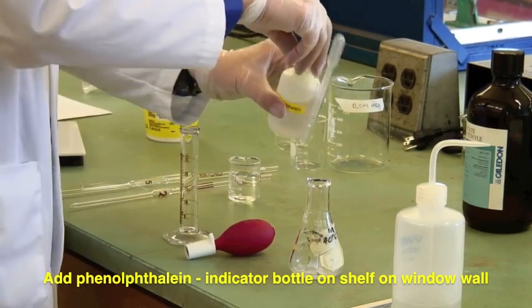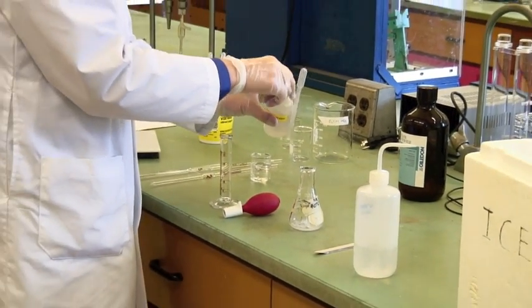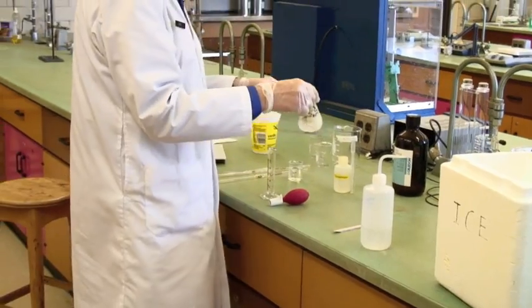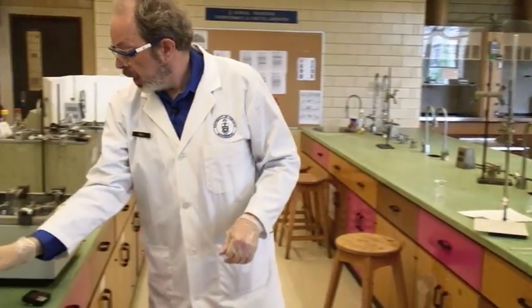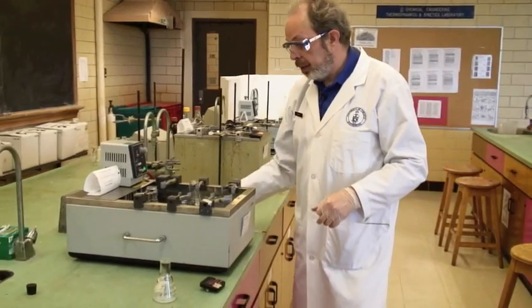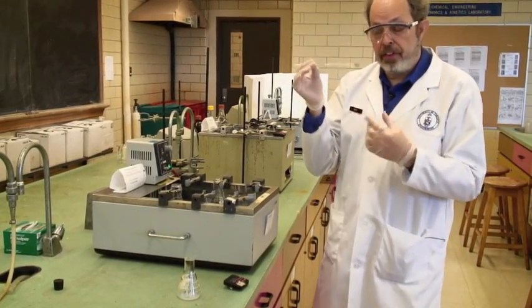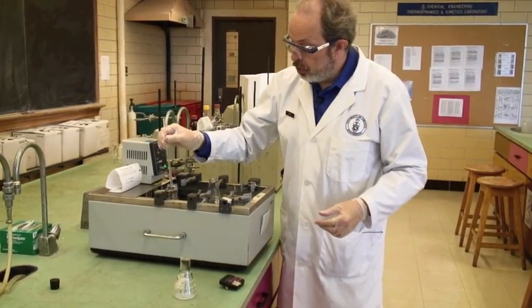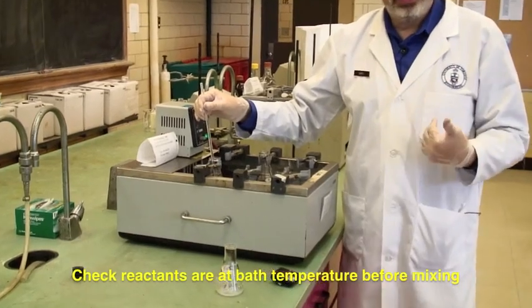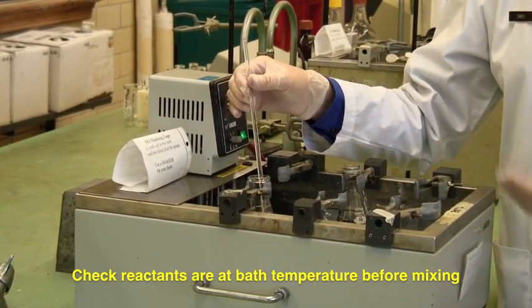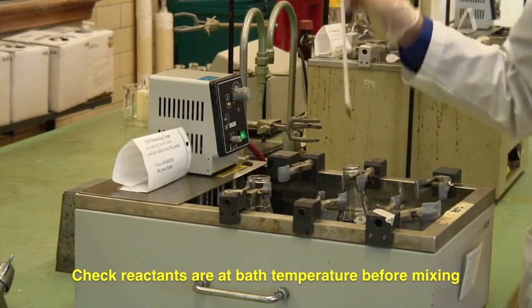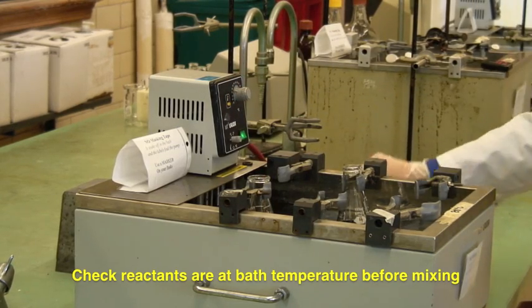I'm now ready. I'm going to take this over to the heater, and you check using this for the first time that you've got the right temperature in your mixture. You only need to do this for the first time, because once it's at temperature, it will stay there until the end of the reaction.